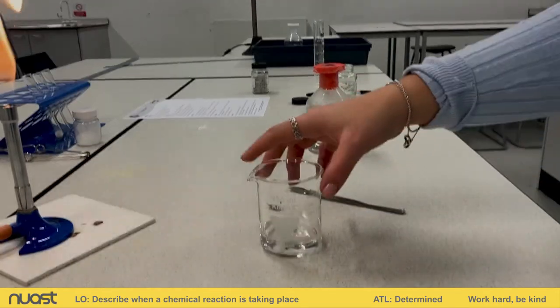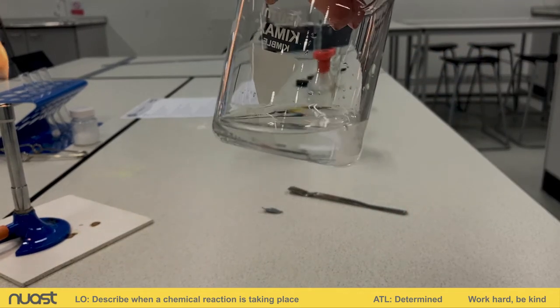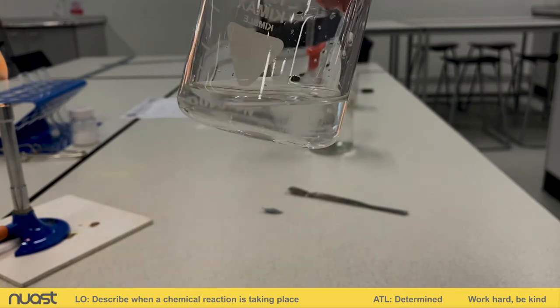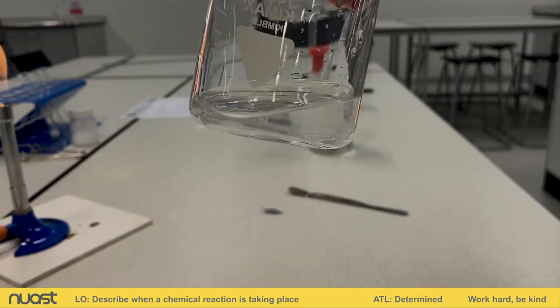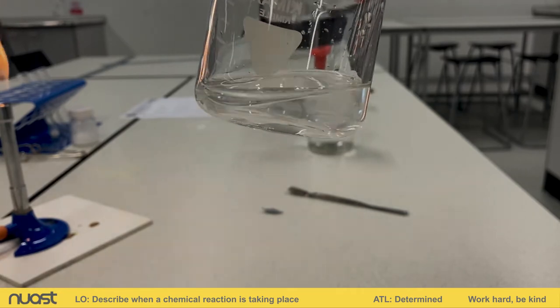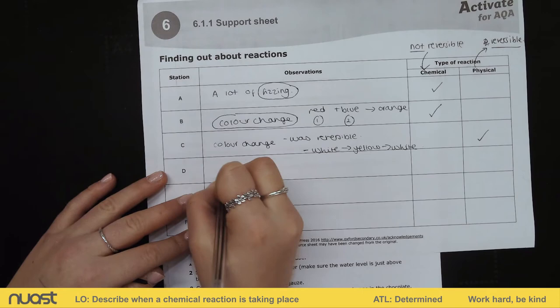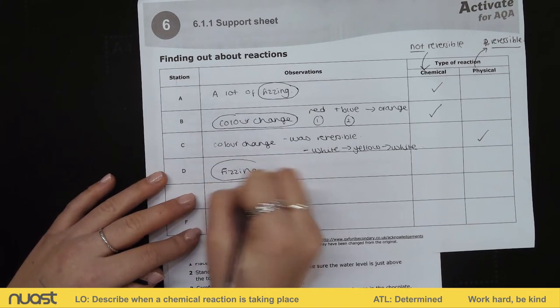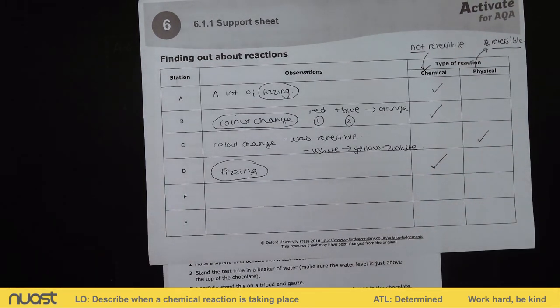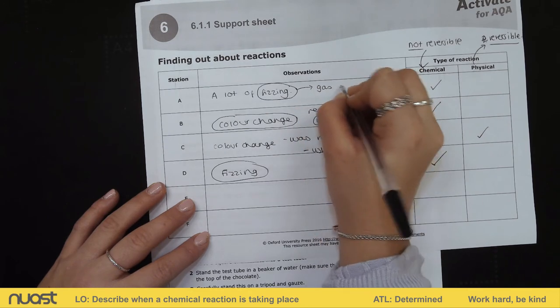You can see that beaker with the hydrochloric acid in. I'm now going to add in my marble chip and bring it closer so you can see. What you should be able to see is the marble chip fizzing away — it's producing a gas and you can see lots of fizzing. So for station D, fizzing is our observation, and that is going to be a chemical change — a non-reversible reaction. The fizzing means that a gas is being produced.